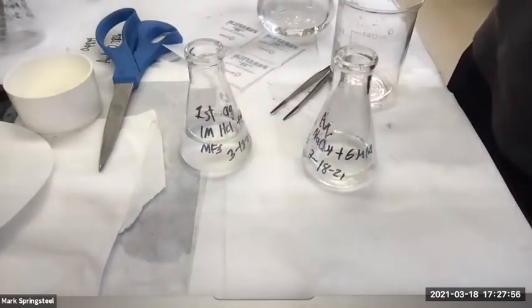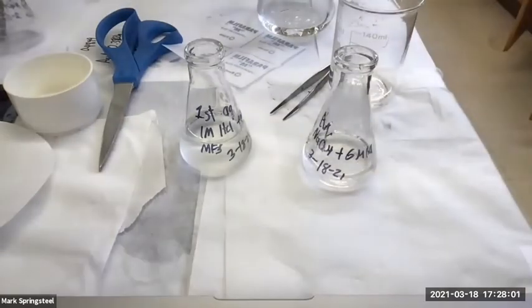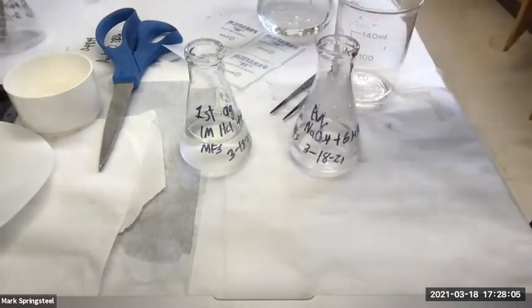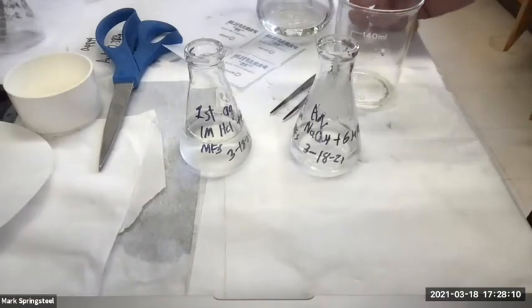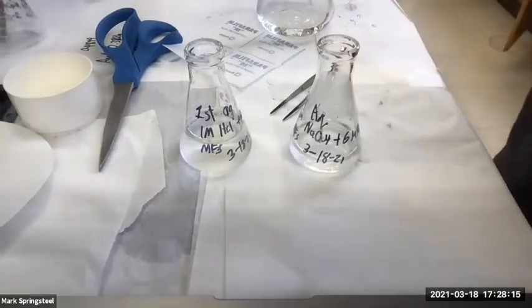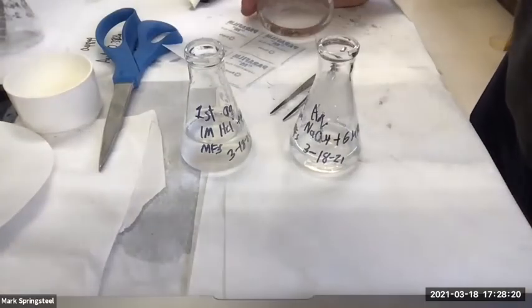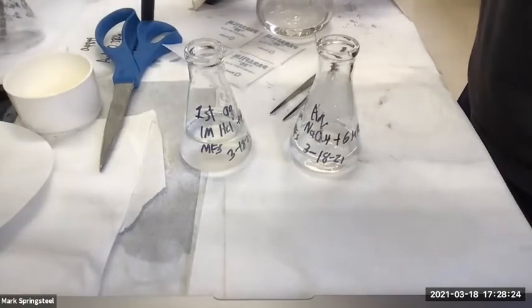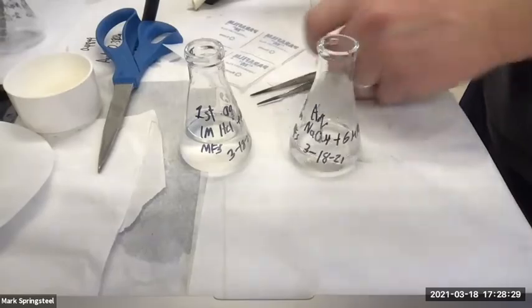So how am I going to quench these? I got 2. No, I only had to do this one once, huh? Because I got no precipitation the second time. But this here is acidic, huh? That's right. This is my second acidic layer because I filtered out the carboxylic acid. So I've got 2 acidic solutions I want to deal with. I don't want to put them right in the waste bottle as is. I want to quench them first. How do I quench them? Use sodium bicarbonate, right? Yes, sodium bicarbonate.